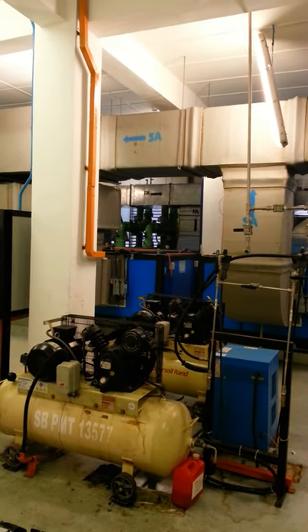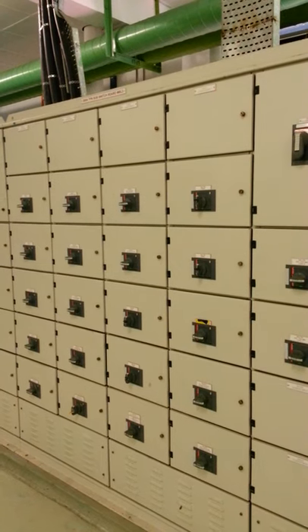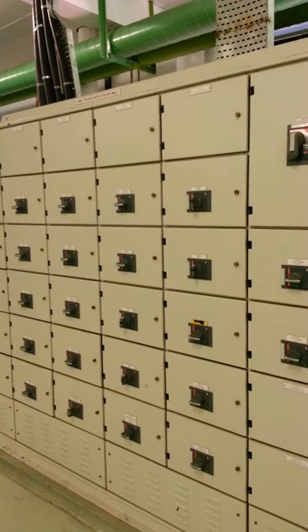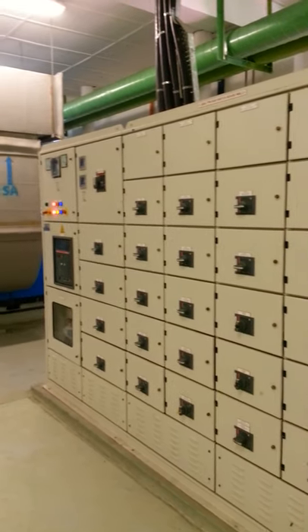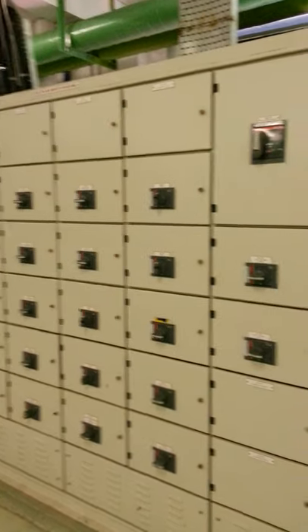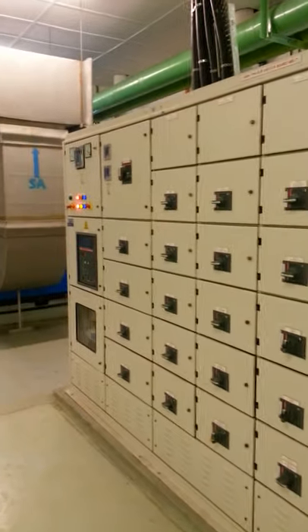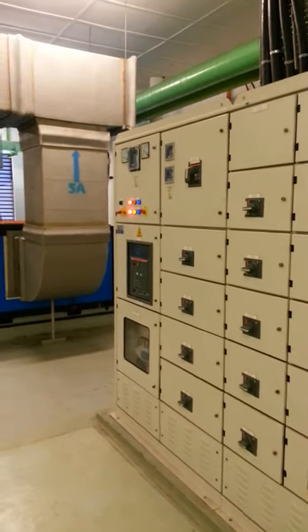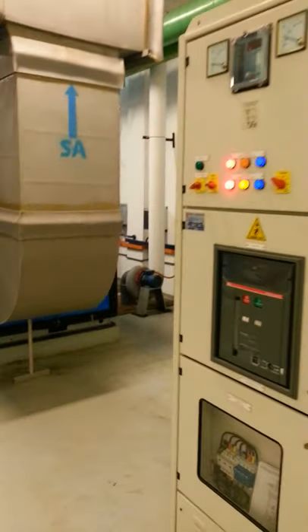I am now at the mechanical control floor, which is responsible for controlling all the heating, ventilation and air conditioning equipment in this facility. We will start off with this panel, which is controlled from a computer below, and this panel controls all the motors and the compressors at this facility.